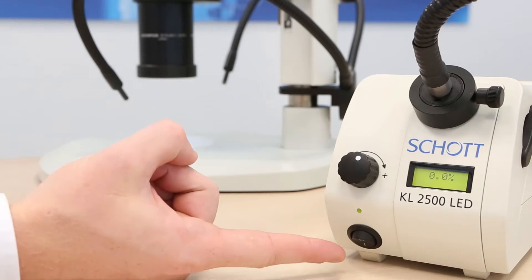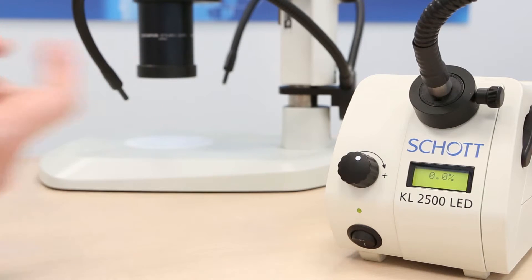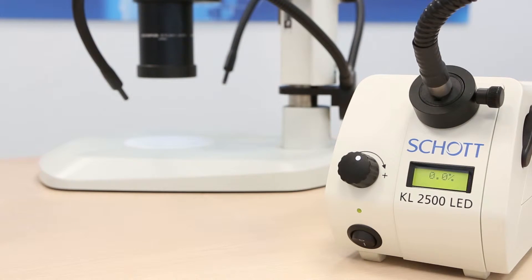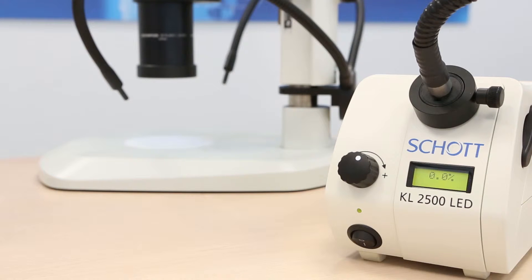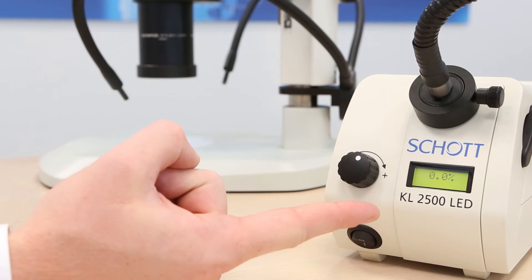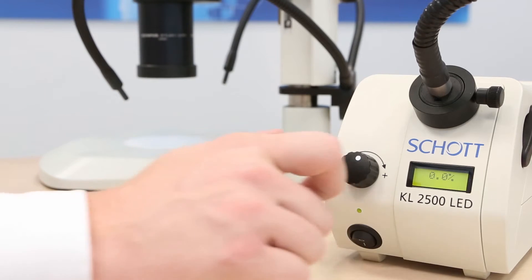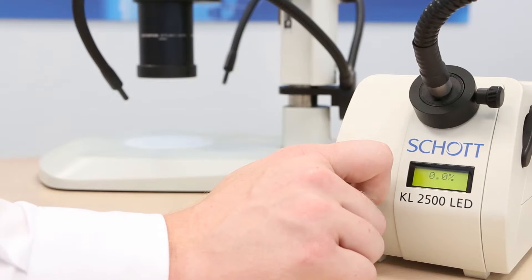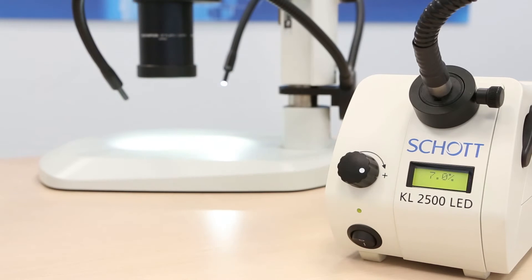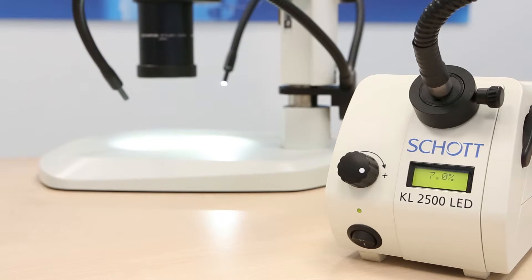You may turn on this device by simply flipping the switch downwards. As you can see right now we are in regular default mode and the brightness is set at zero percent. In this mode you may adjust the light in increments of one percent. As you see right now we are at seven percent.